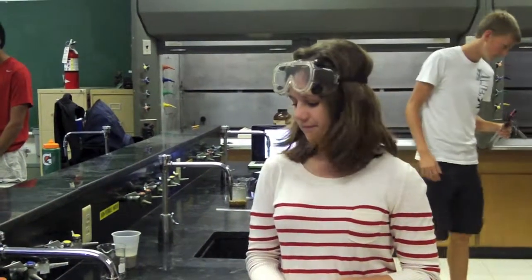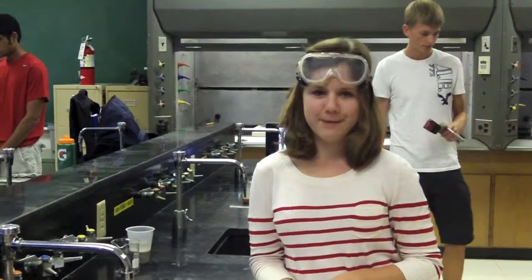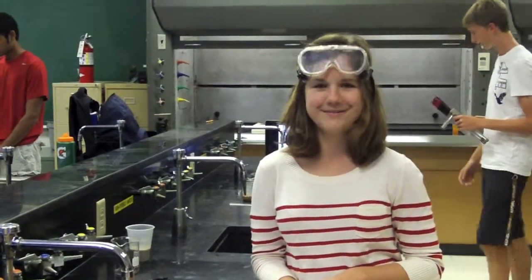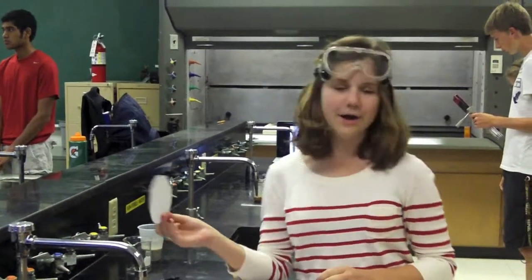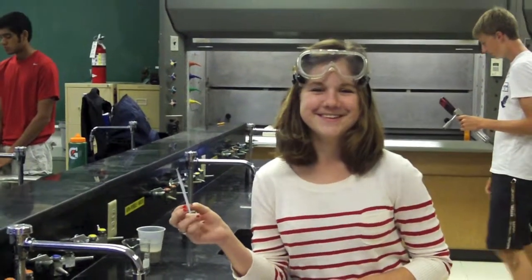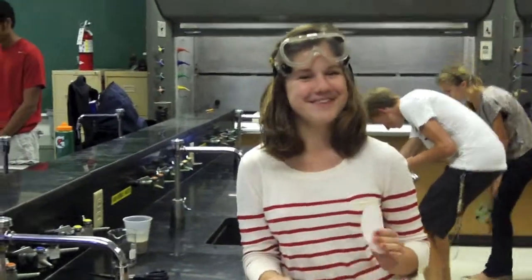This method is often used to find the mass of a product created, but the product might be mixed with another product of the reaction. So we're going to act as if we're finding the mass of a solid produced, even though there's liquid present.